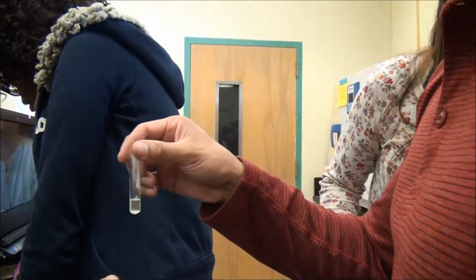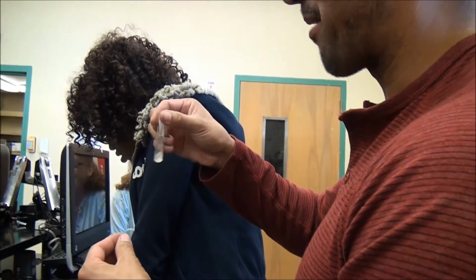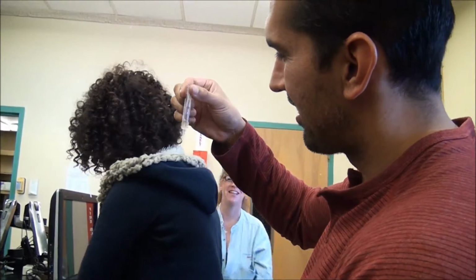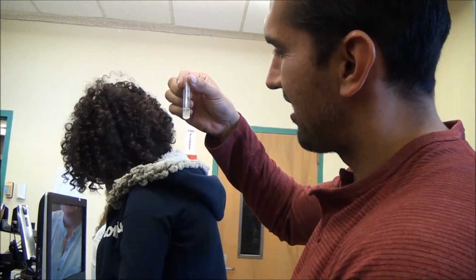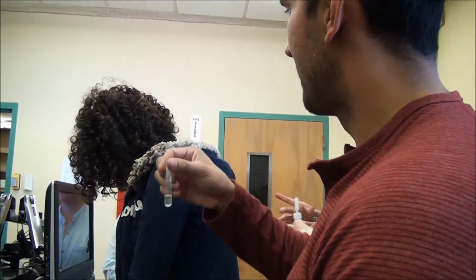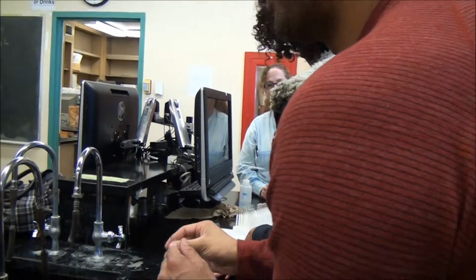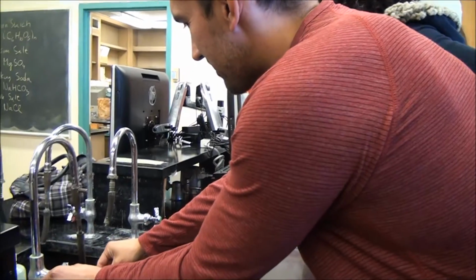We put way too much water into it. That's kind of part of what happened. That's all right. Make your adjustments. Put more iodine. Who said that? Who said that? Start over. I have a feeling we're all going to repeat chemistry.